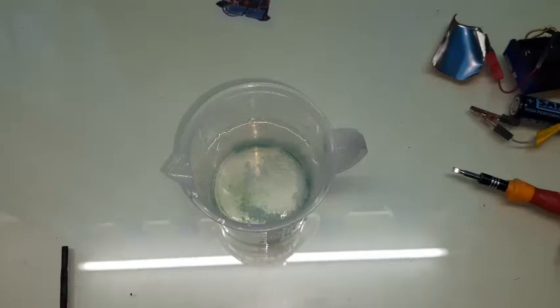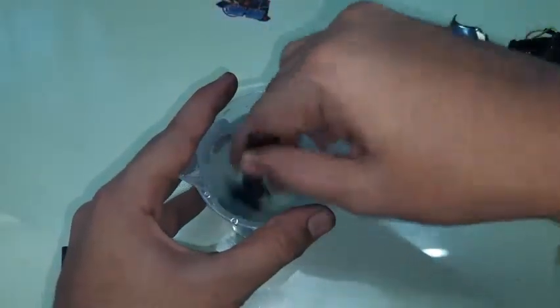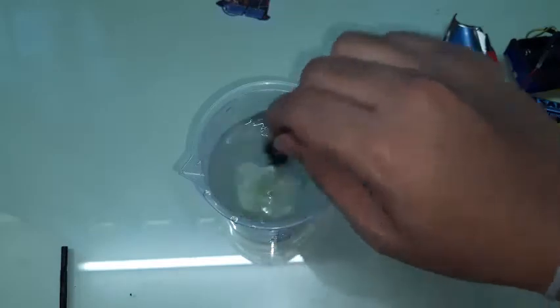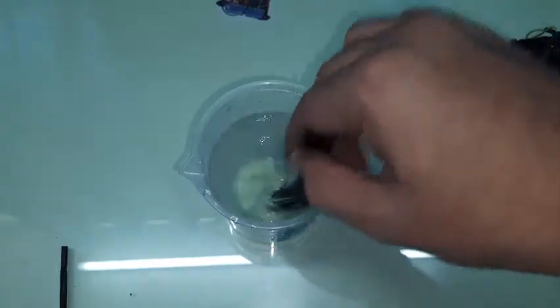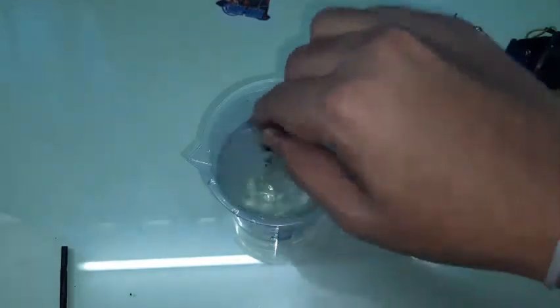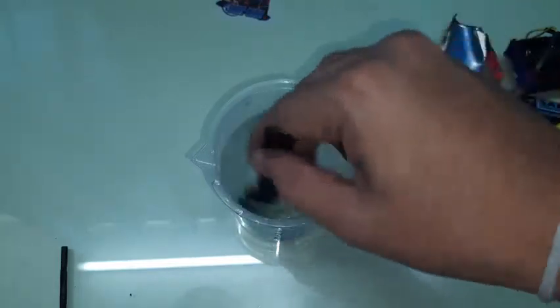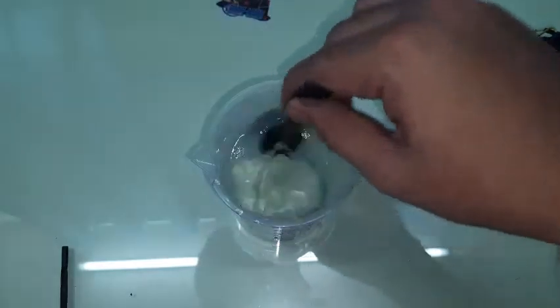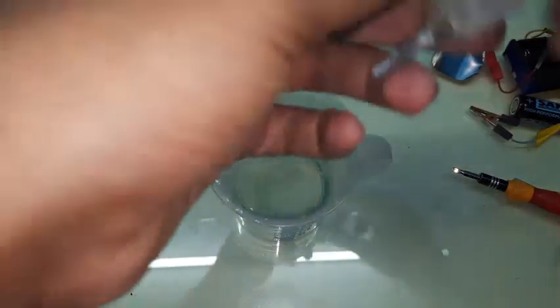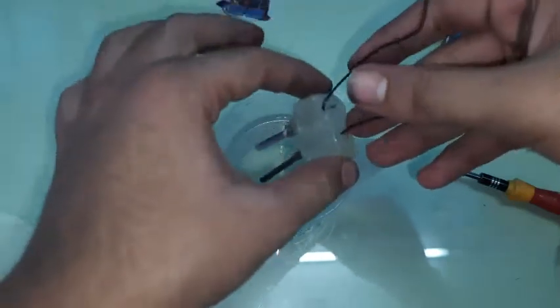I've added about two grams of salt to 200 ml of water and I'm mixing that now. If you're just tying wires directly to the electrodes, make sure the wires do not touch the electrolyte solution — use clothespins or any clips to hang them on top of the container so only the carbon tip goes in. You can increase the time or increase the salt concentration to get a higher concentration of sodium hypochlorite.